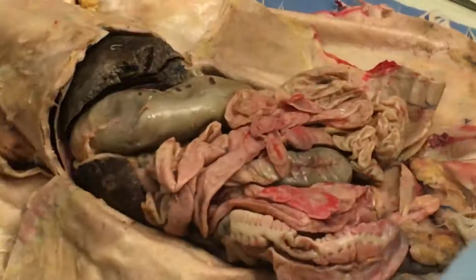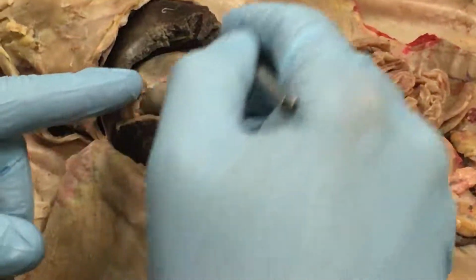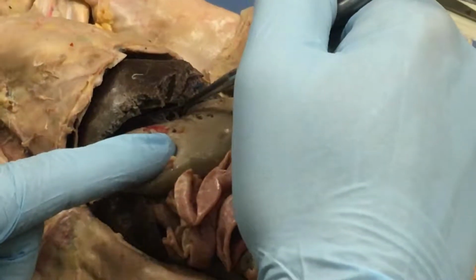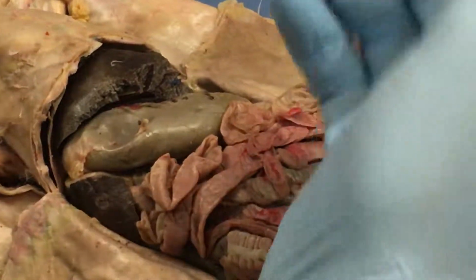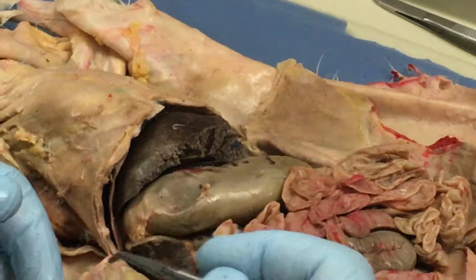So that's just review. That's nothing new. But you're seeing it for real. Cardia, fundus, body, pylorus. Okay? And if you just memorize it in order like that, because that's the order from top to bottom, that probably makes it easiest. All right?